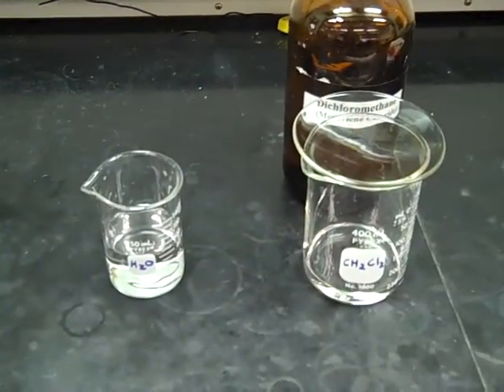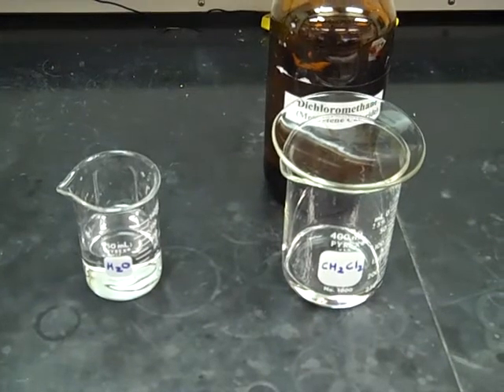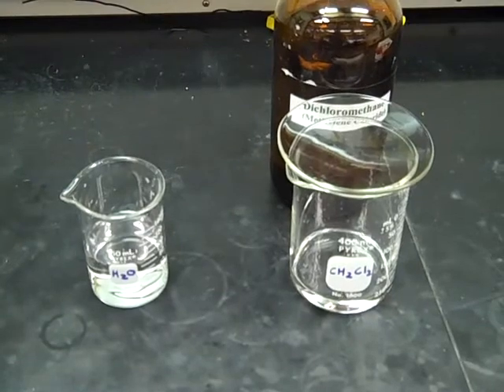So as I said, we're separating two immiscible liquids. Oftentimes, one of those liquids, the organic layer, may be from a reaction that you've just done.